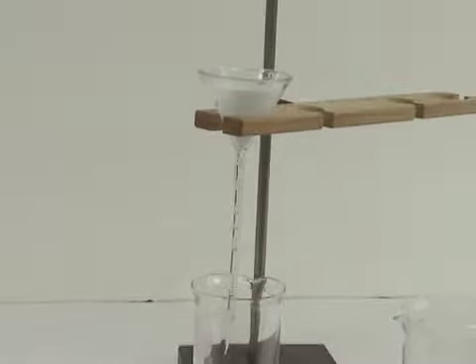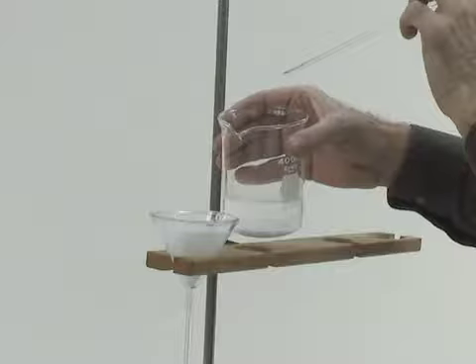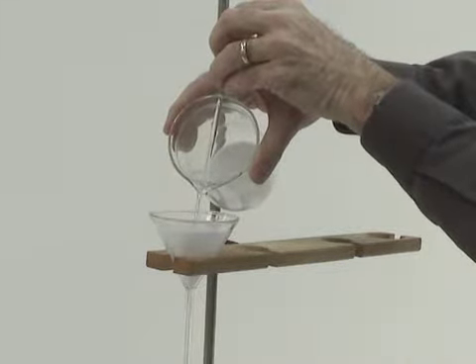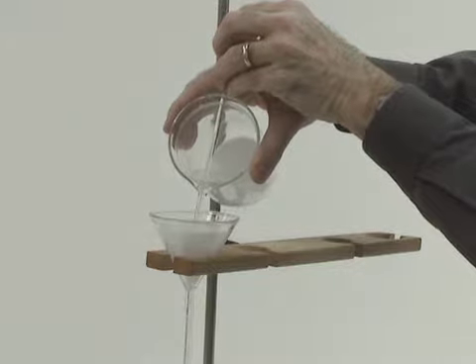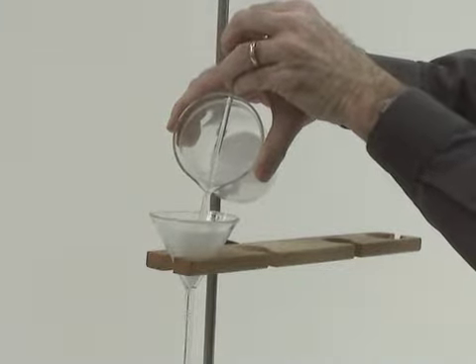The first step is to decant the supernatant liquid. That's fancy chemistry talk for removing the clear liquid that sits above the precipitate. We try to do this without disturbing the solid precipitate any more than is necessary. The best way to do this is to use a stirring rod as a guide. This will keep the solid in the beaker, and at the same time it will direct the flow of the liquid into the center of the cone. This will avoid spills and drips.